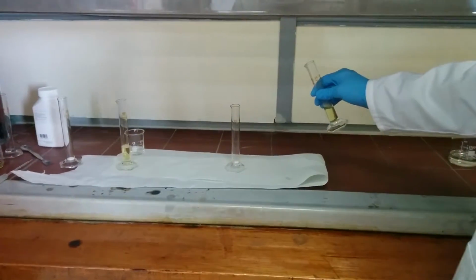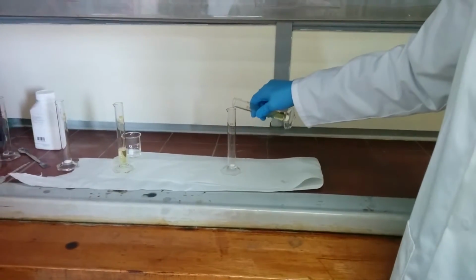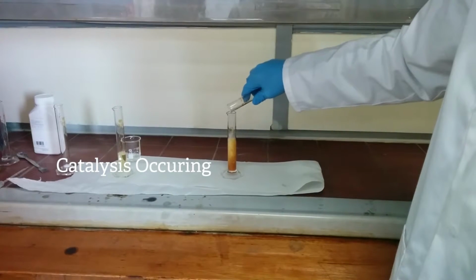As the hydrogen peroxide comes in contact with potassium iodide, they react, then oxygen and water are released. This water combines with the detergent to make bubbles and is expanded rapidly by the formation of oxygen gas, pushing the bubbles apart and increasing their volume to expand the foam.